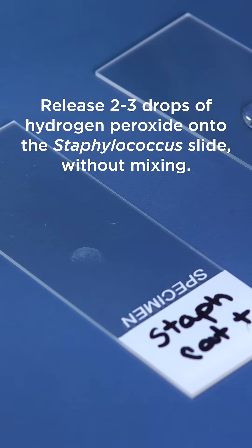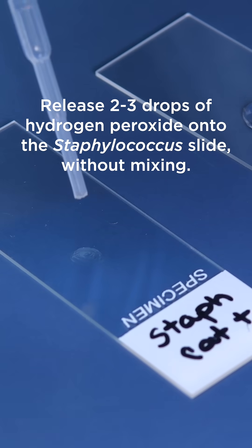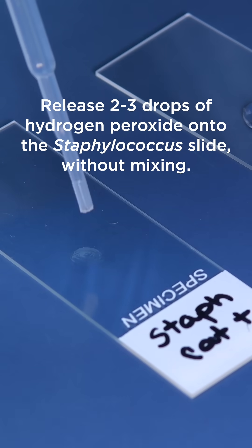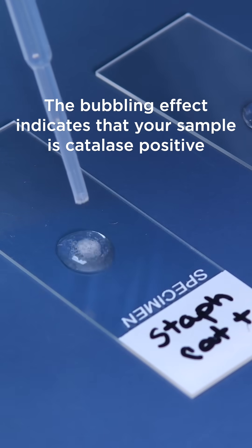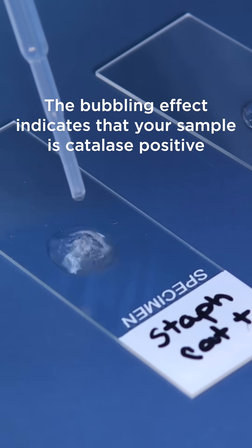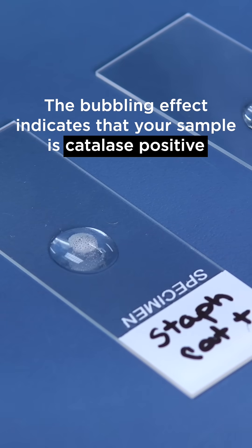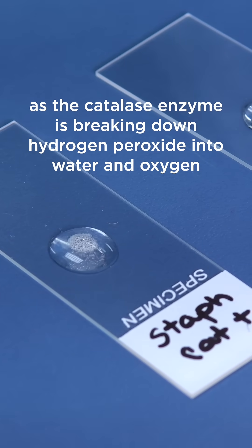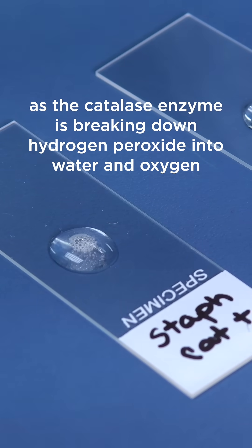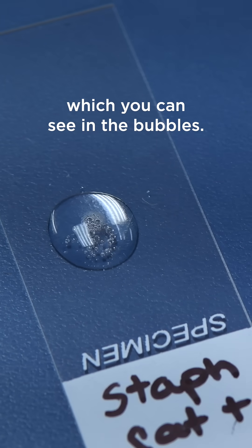Release 2–3 drops of hydrogen peroxide onto the staphylococcus slide without mixing. The bubbling effect indicates that your sample is catalase positive, as the catalase enzyme is breaking down the hydrogen peroxide into water and oxygen, which you can see in the bubbles.